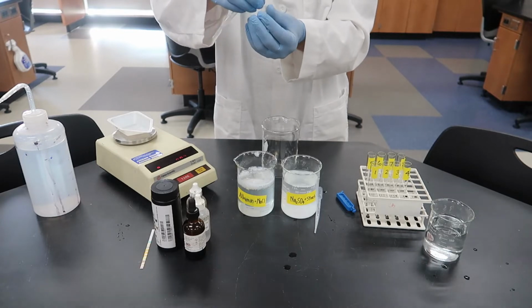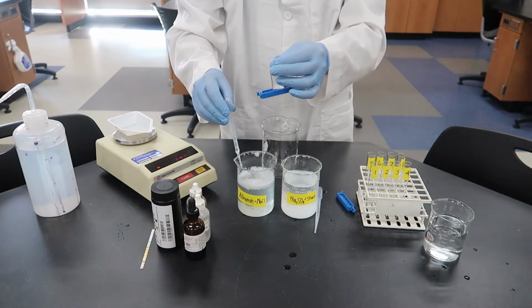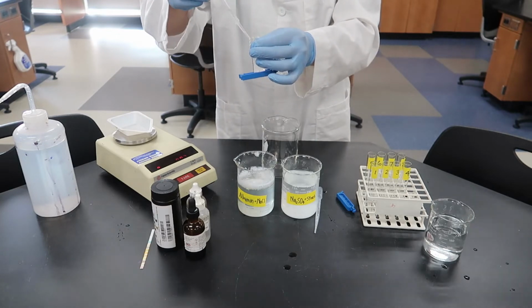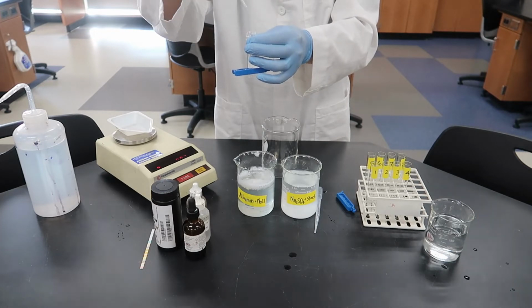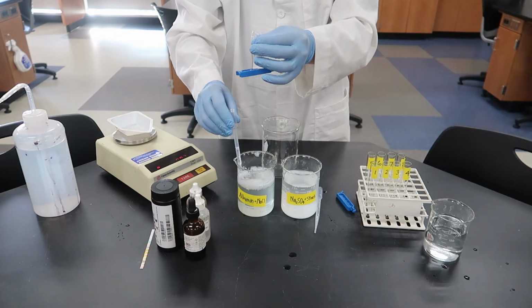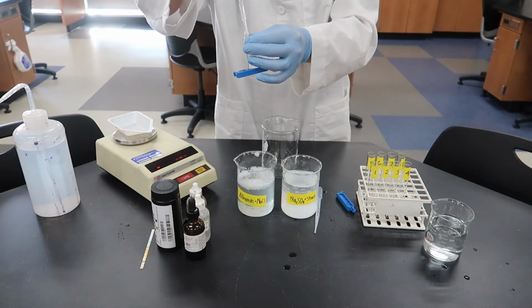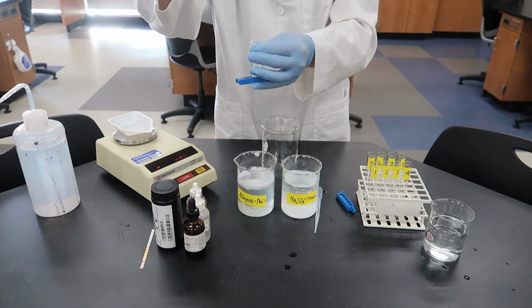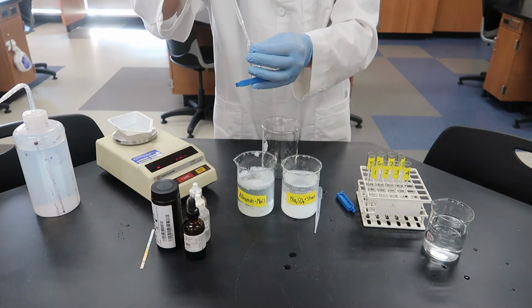Remember, our goal is to find out which compounds, albumin, NaCl, Na2SO4, or starch, or water, will pass through the bag. Now, we haven't talked about this yet, but how are we going to find out if water goes in or out of the bag during our experiment? Is there a way that we could measure whether or not water goes in and out? Think about that for a few minutes, and then we'll come back to that question.